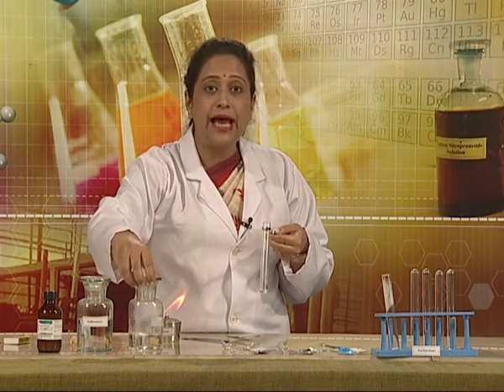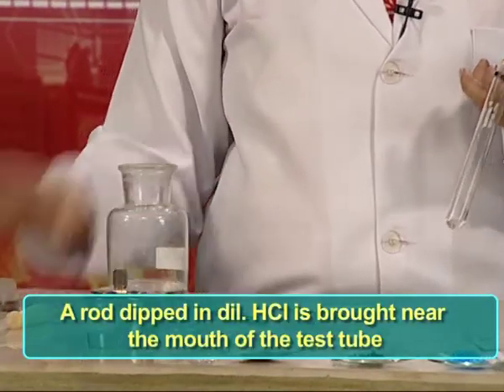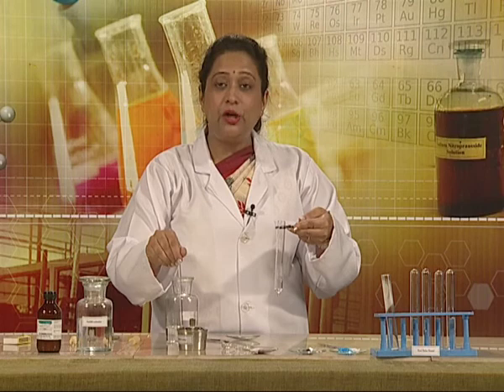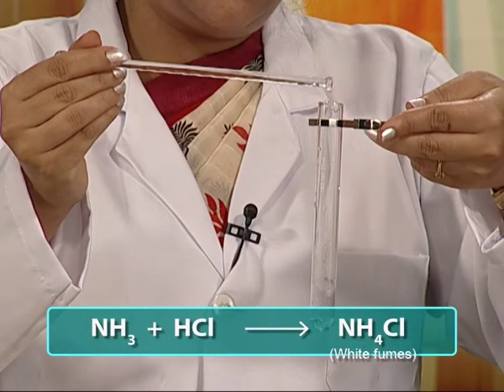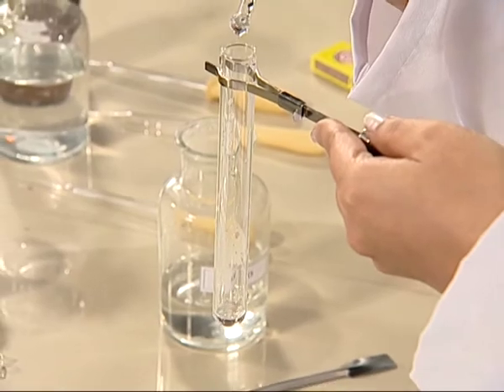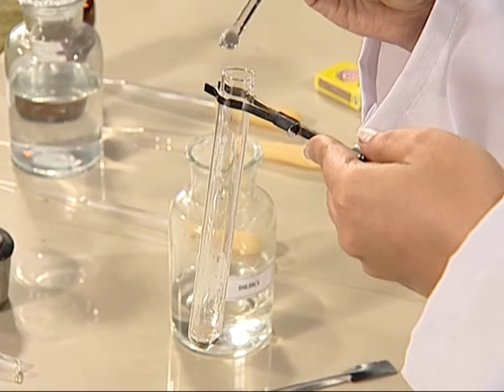Now we would need dilute hydrochloric acid. Let us switch off the spirit lamp and bring a glass rod dipped in dilute hydrochloric acid. Ammonia gas in contact with dilute HCl forms white dense fumes of ammonium chloride, as can be seen here. The white dense fumes are of ammonium chloride. It is one of the confirmatory tests for the ammonium ion. These fumes in solid state may also deposit on the glass rod.